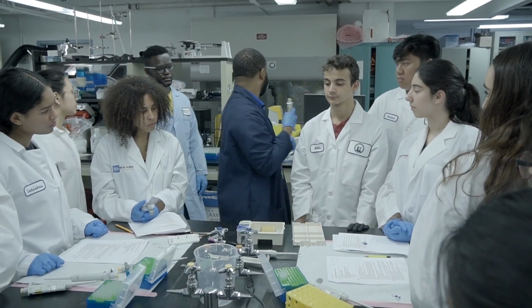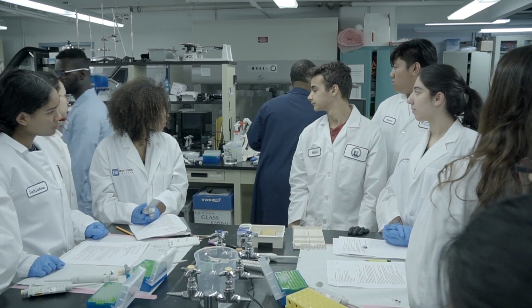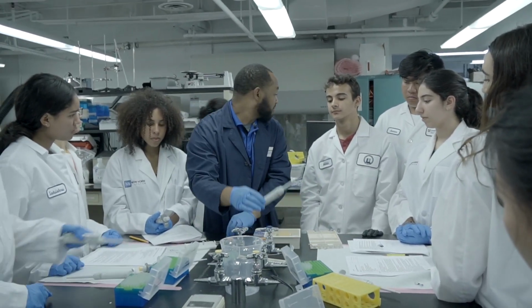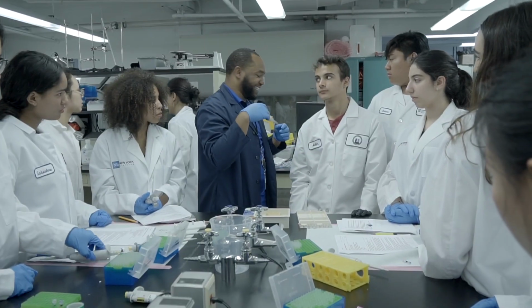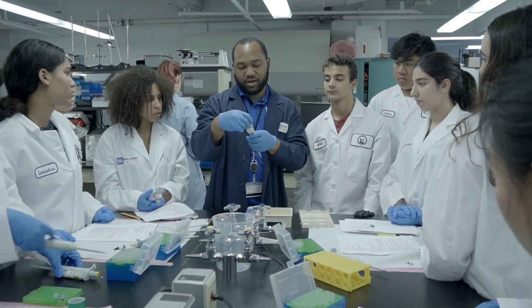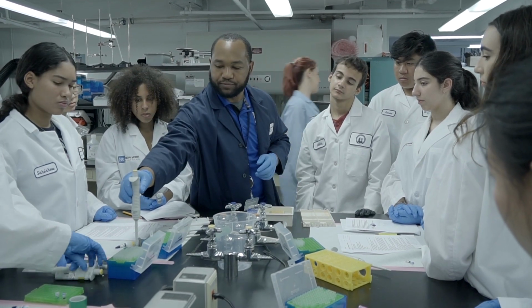This is the broken one, that's why. No, it's fine. Yeah, it's all good. There's 2 broken ones. Clearly. So I thought it wasn't turning correctly either. Okay.